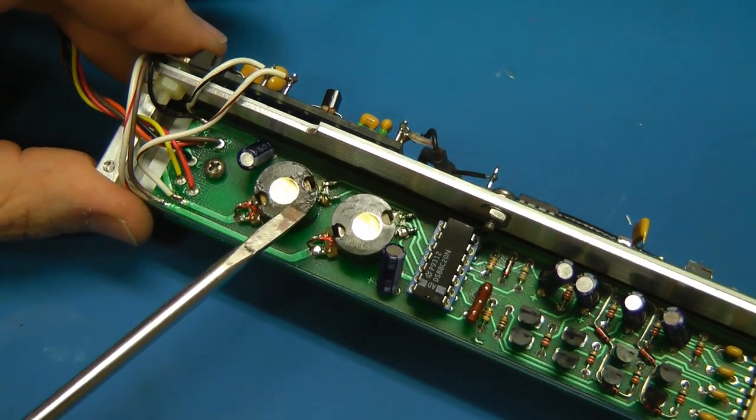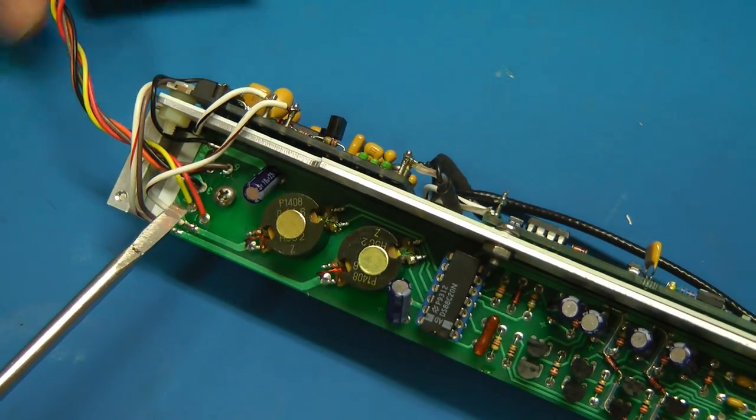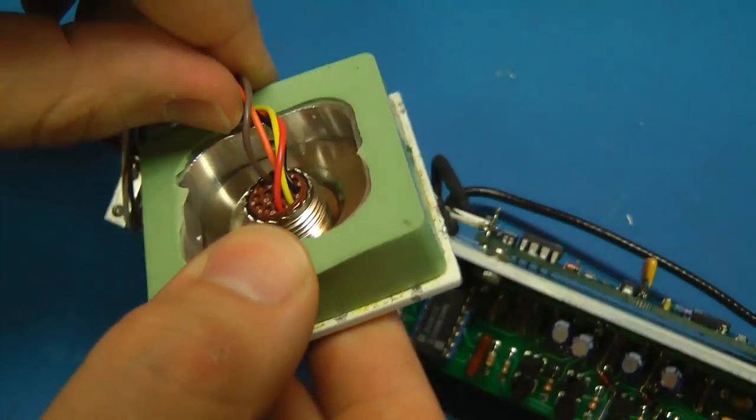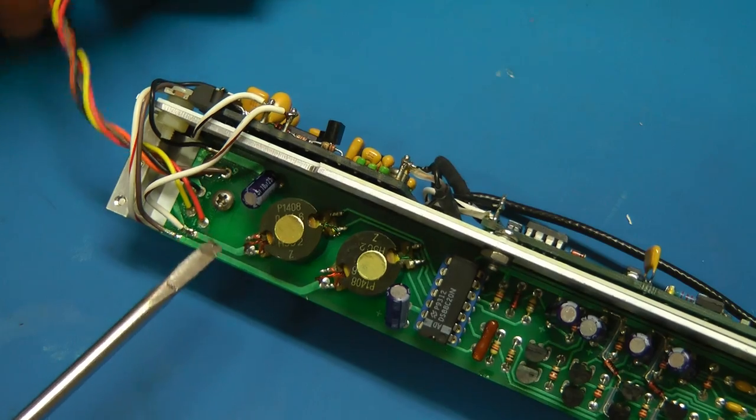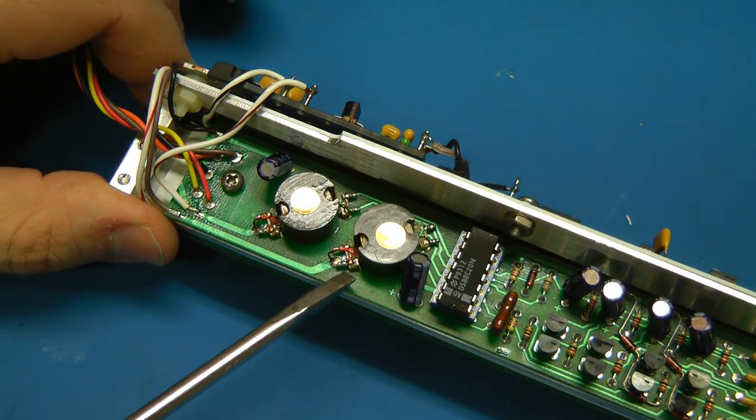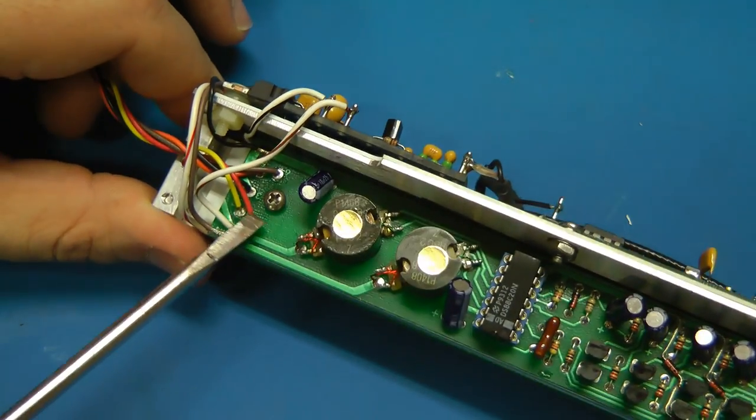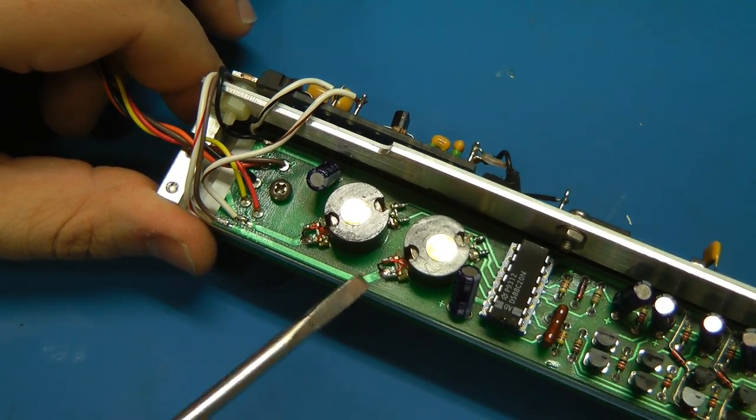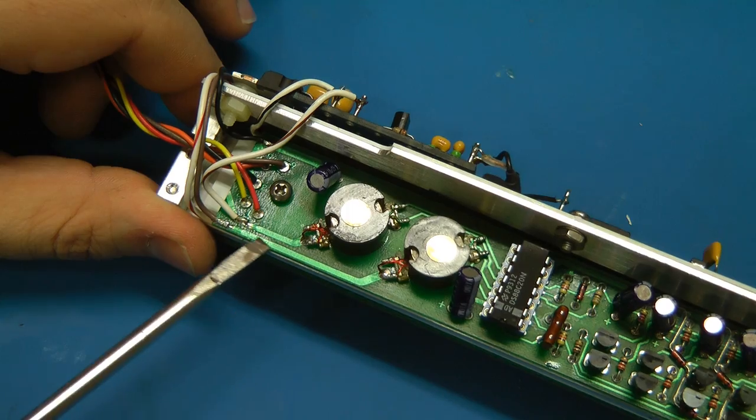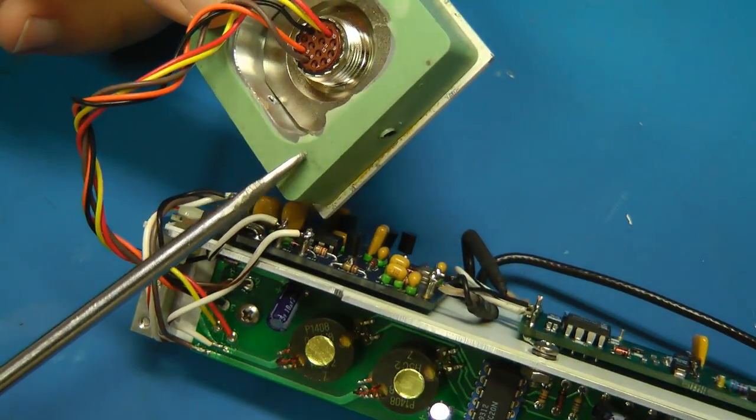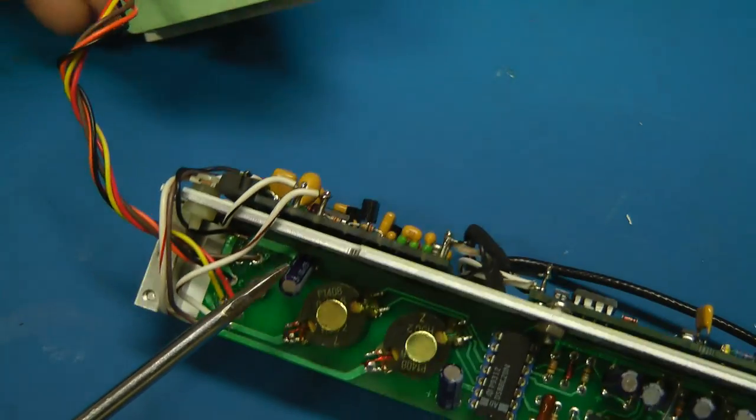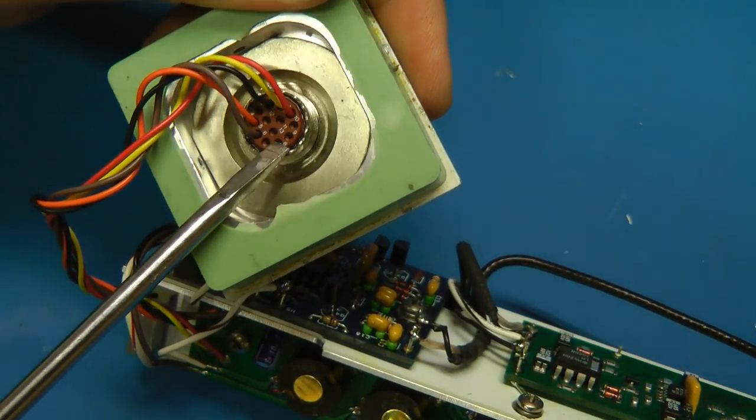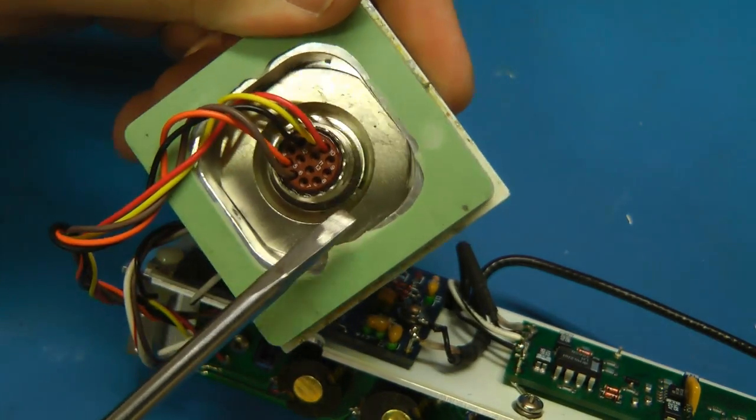Actually, this may be sort of like power over ethernet. Yeah, that makes sense. So there's only five wires, probably ground plus two data lines. But yeah, these seem to appear to be coupling transformers. Because the two lines go under here to these two on each one. And then there's a common center tap coming out that goes off to the power supply board. So yeah, they're doing some sort of like a power over data line thing here. That's interesting. And they had plenty of pins, they didn't have to do that. There was no reason to do that. So wondering why they did it that way. They could easily have taken power over these pins straight to this.